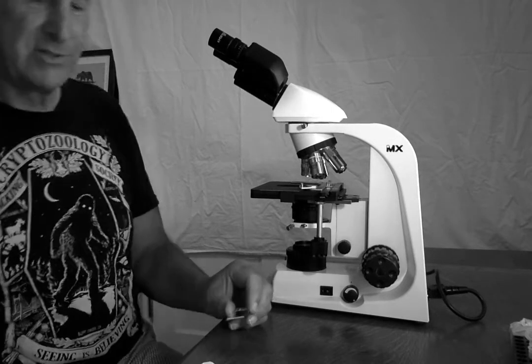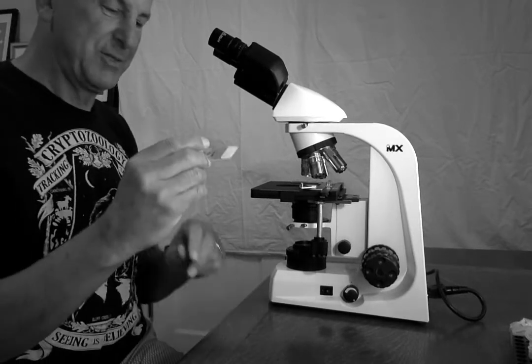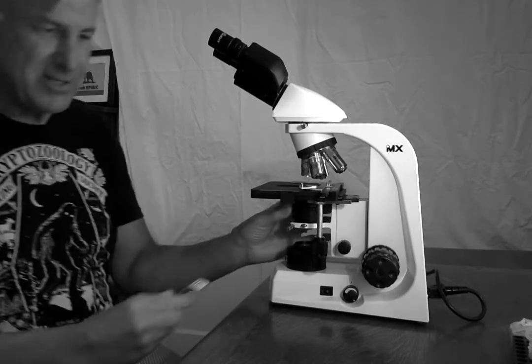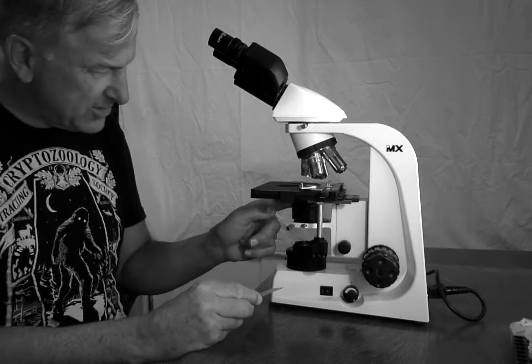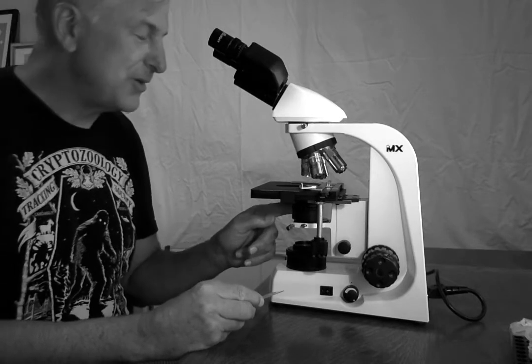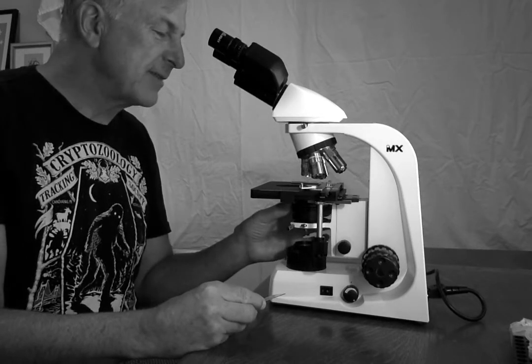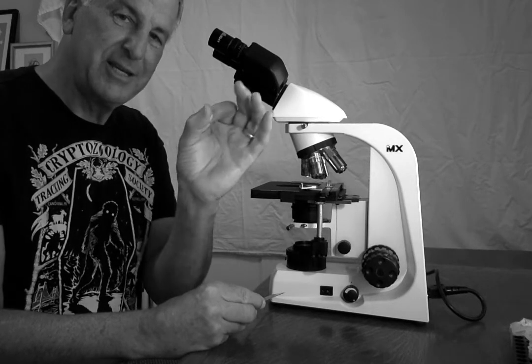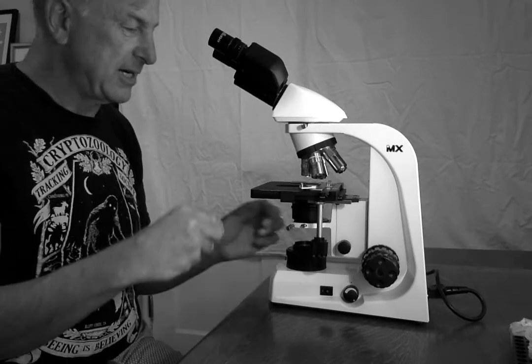All right, so next up, it's time to look at something. I'm going to use the same slide because it had some cool stuff on it. Oh, wait a minute, one more thing. There is another adjustment knob here, the condenser iris diaphragm, which also affects how much light is coming through. I remember on the scopes we used in school, there were a bunch of little circles of different size, and this replicates that by opening and closing, again, the amount of light coming through, and this controls it.